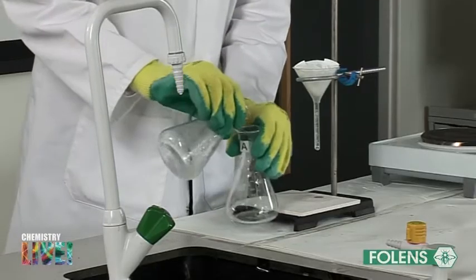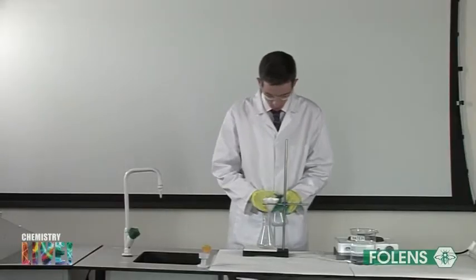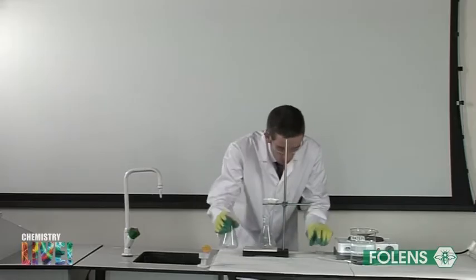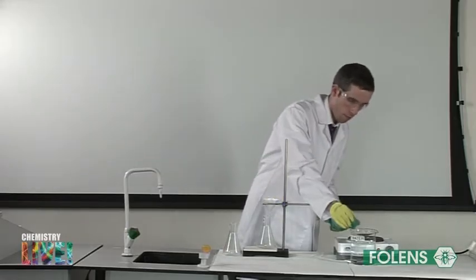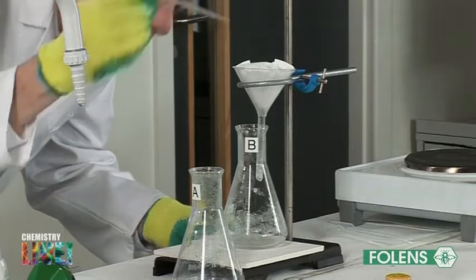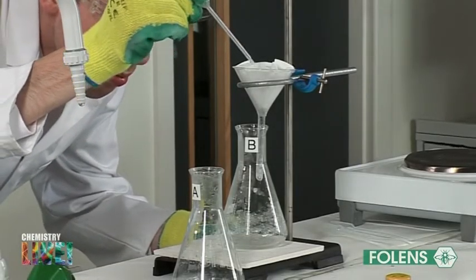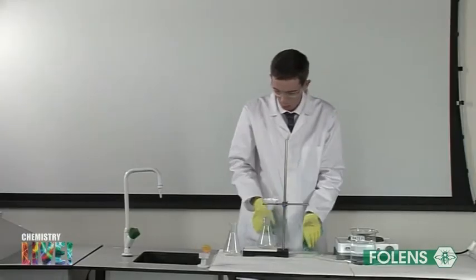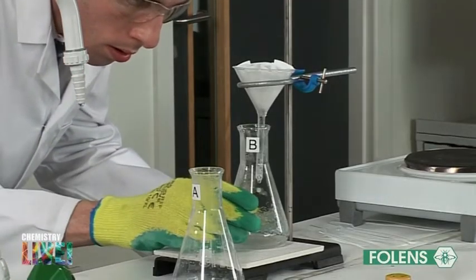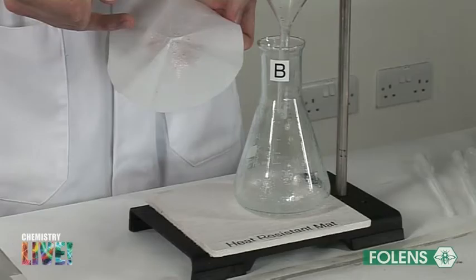It may be necessary to heat conical flask A from time to time on the hot plate if crystals are observed coming out of solution. Soluble impurities, together with the dissolved benzoic acid, pass through the filter paper. Conical flask A is rinsed with the filtrate to remove any remaining benzoic acid solution, and the washings are passed through the fluted filter paper. It would not be a good idea to add additional water to conical flask A, as this would make it more difficult to crystallise out the pure benzoic acid at a later stage — we need to keep the solution saturated. Insoluble impurities are left behind in the filter paper; this filter paper is removed and discarded in the rubbish bin.